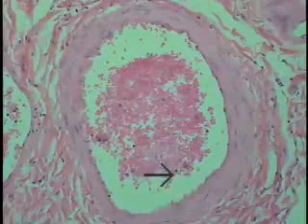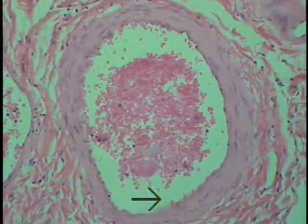Just quickly repeating our previous observation, this is a small muscular artery, internal elastic membrane still present, dominant feature the media of the smooth muscle. Companion vein shown there. A yet smaller tributary, still classified as a small artery, as is shown here. And once again, the dominant feature is that smooth muscle wall of the tunica media, even though one can visualize, even with the H&E preparation, the position of the internal elastic membrane. So it retains its position.